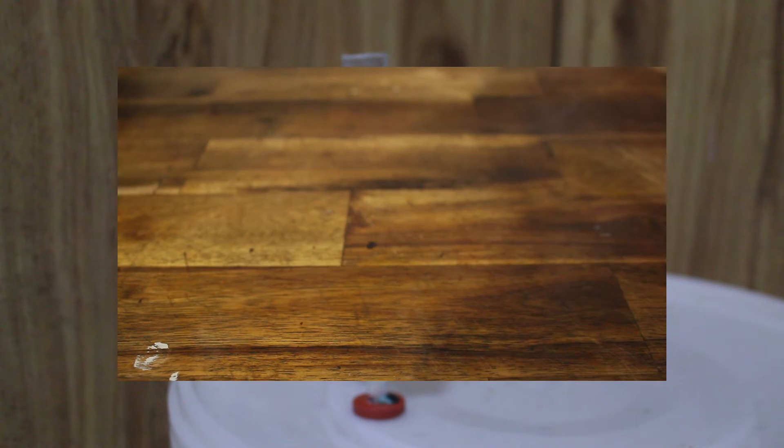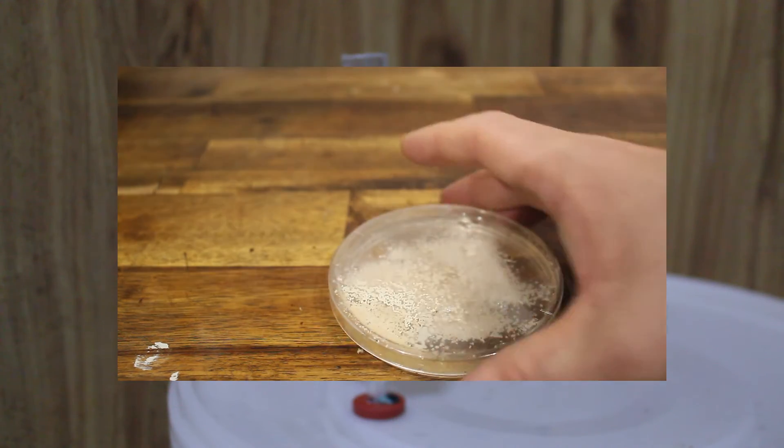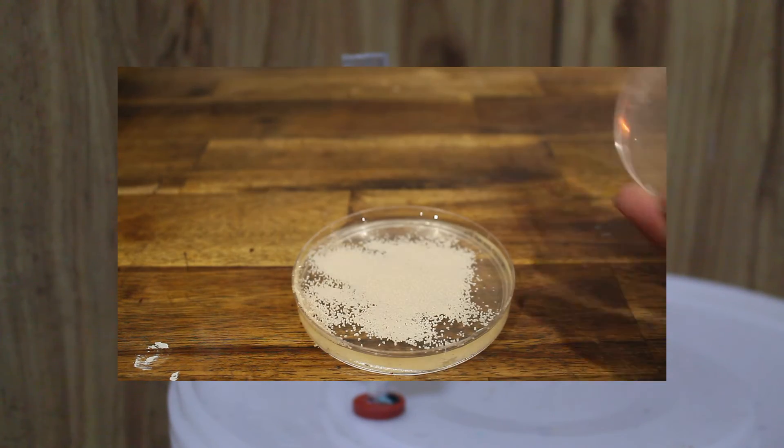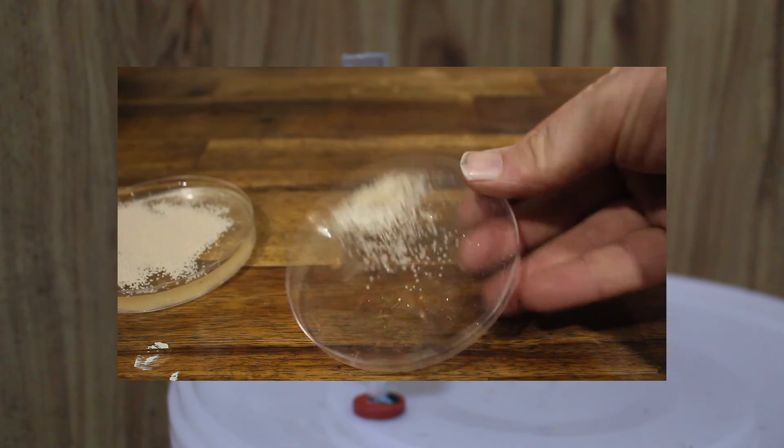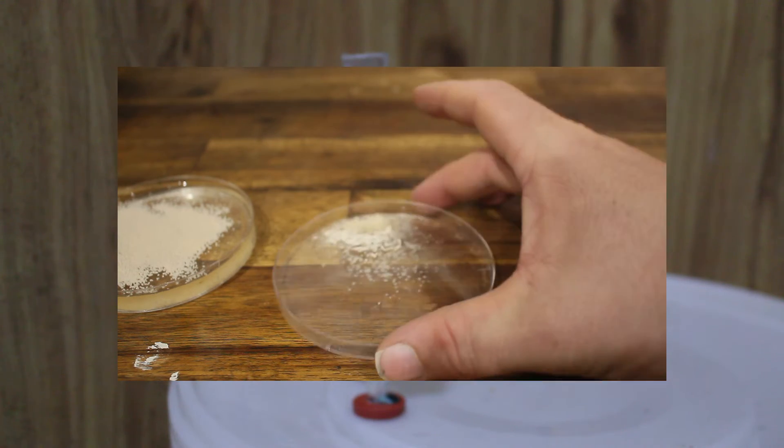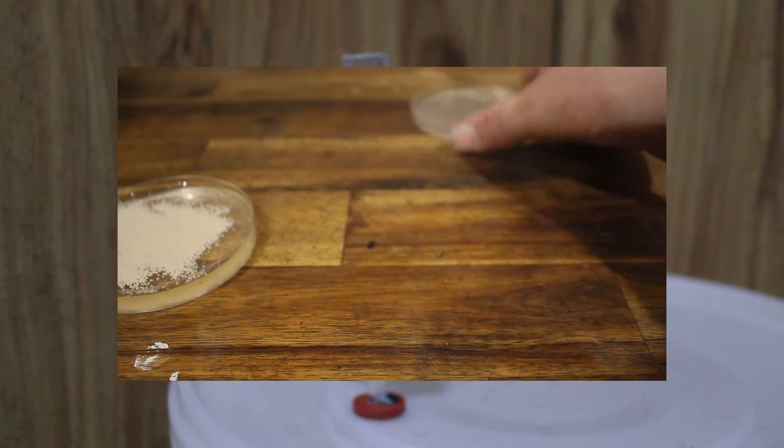What we do need to do is keep this warm at between 20 and 30 degrees celsius depending on the yeast strain. Maintain this temperature for between 24 and 48 hours. At the end you should have very obvious yeast growth.